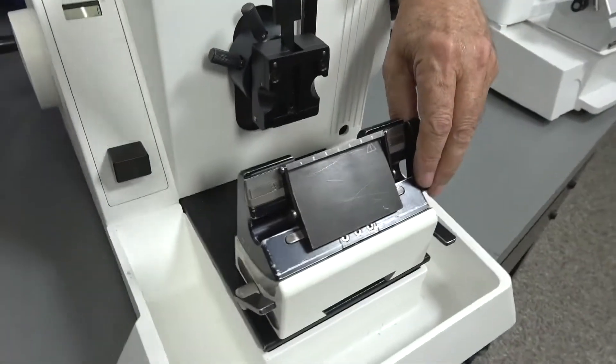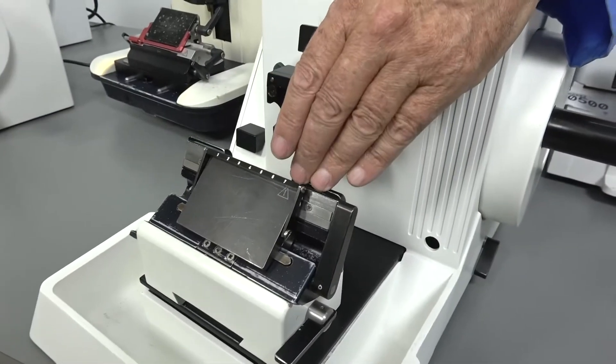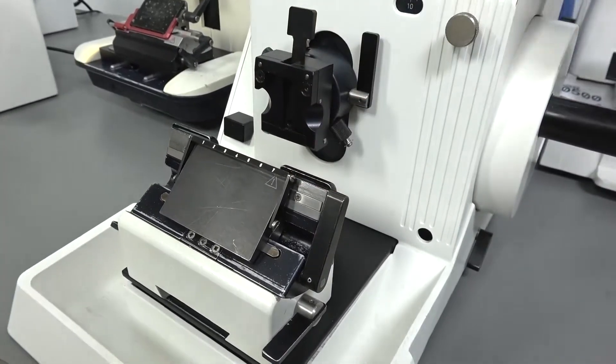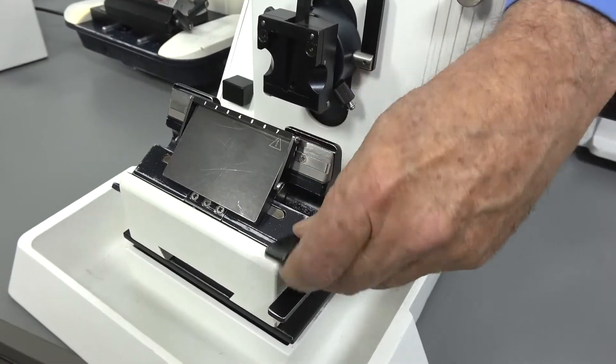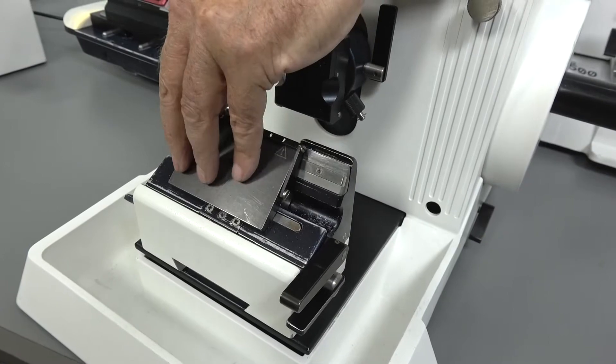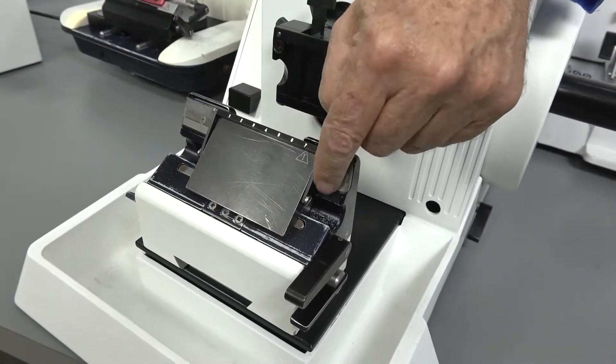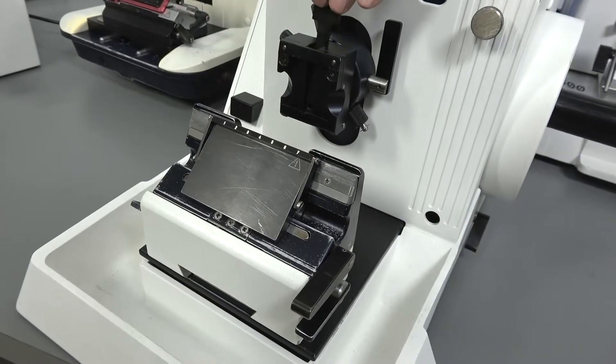And I guess probably the newest feature that is on this knife and not on that knife, and it's actually on almost all the rest of the units, is that this does have a lateral knife movement. So you can put in your blade and adjust your knife down so you're cutting on a fresh section of blade.